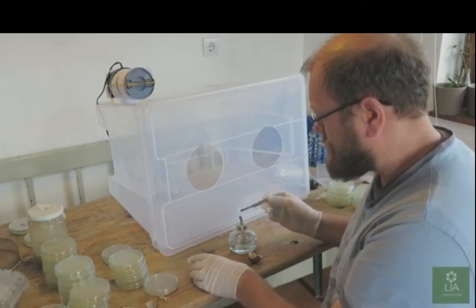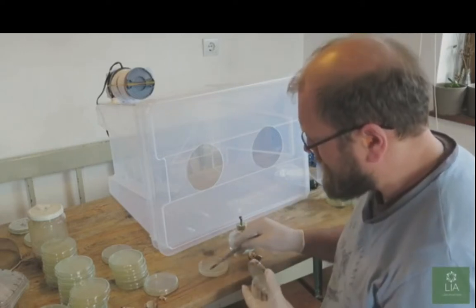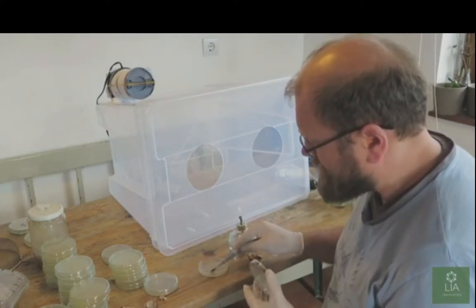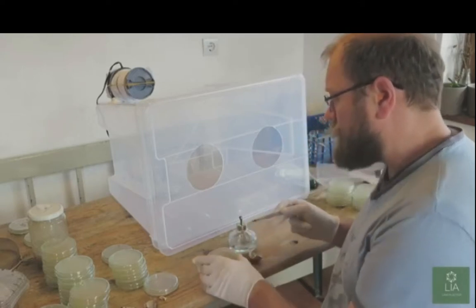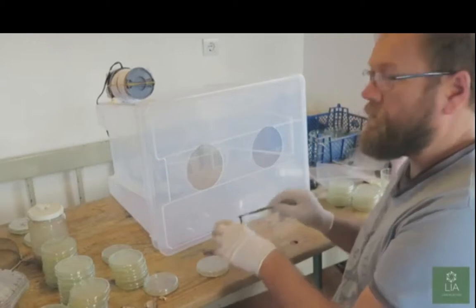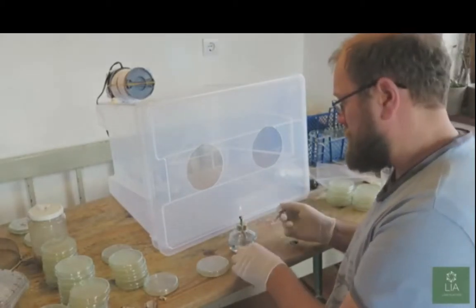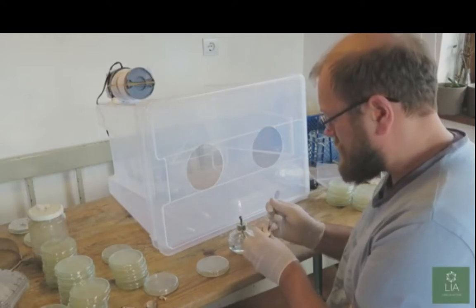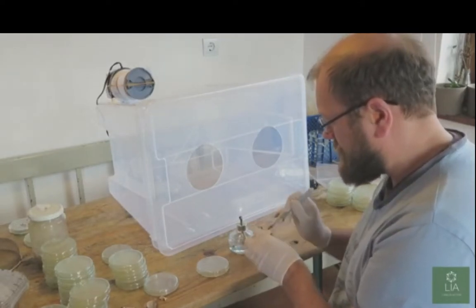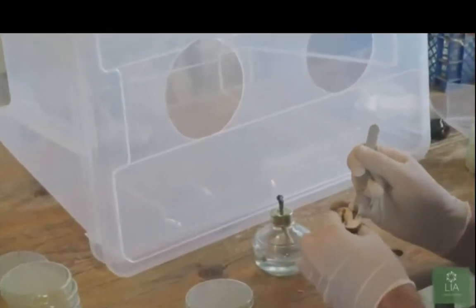Blade. Okay. Then place it into the agar that you're going to be using to transfer your sample into. Because what you don't want to get is any cross-contamination. So you're always doing the same thing with the same petri dish. Sterilize, work with the petri dish. So we're going to take a small tissue sample. It doesn't have to be large. You can just take a small tissue sample from this.